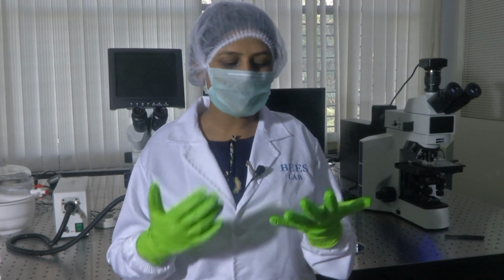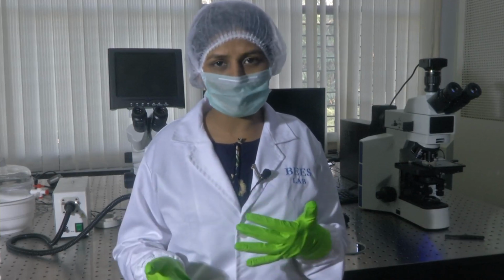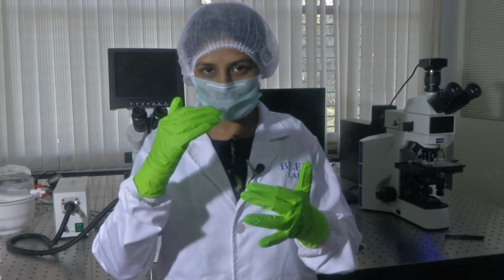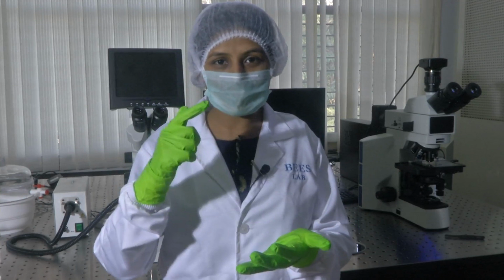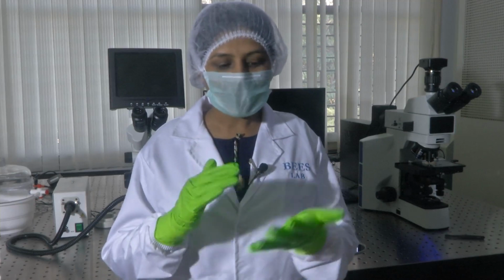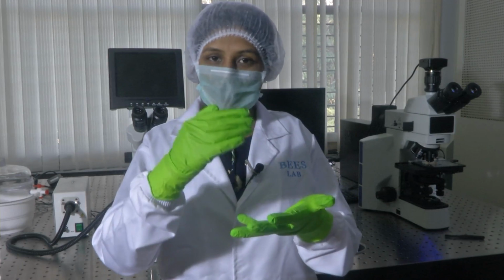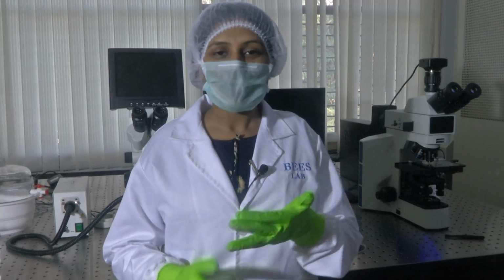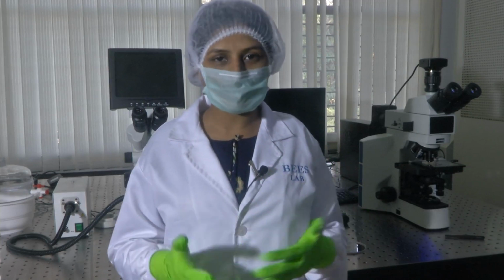So all of these that I have listed, the metallurgical microscope, the stereo microscope and the inverted microscope, are optics based, that is, based on transmission and reflectance of light. Either the light flows through the sample and reflects back, and the image is formed based on the reflected light, which is the reflection principle. And in the transmission principle, the light is transmitted through your sample and the transmitted light is captured to form your image. So it could be transmitted or reflected based optical methods of imaging.